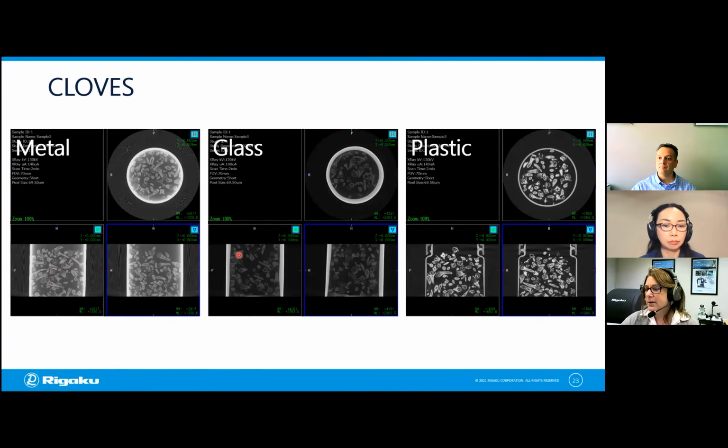Okay, so we're just going to quickly look at that for just a second. So I have the sample that you imaged before, and if I want to go to a smaller sample and move the sample closer to the detector, I need to actually switch containers. So to move from the larger field of view to the smaller one requires a different container. It also requires a different stand. So I hope you can see this. Perhaps if I turn it this way.